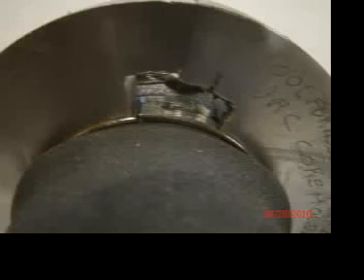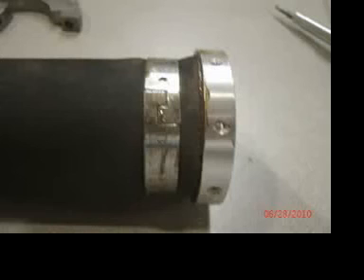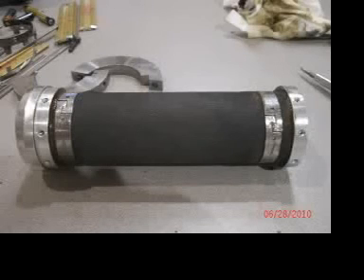Oh boy, looks like we got it great here, and that is about the best you're going to get out of it. And take the fixture off, and you can see we got it all together pretty nice. Nice try, first time. And now you should be at this point. Note that the ends of the clamps do not have to be in the same place.